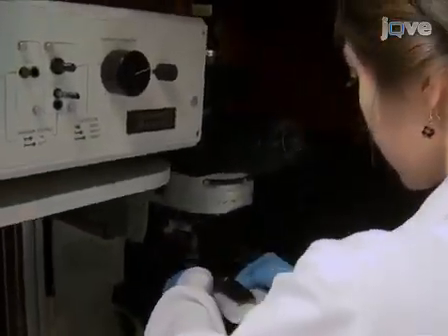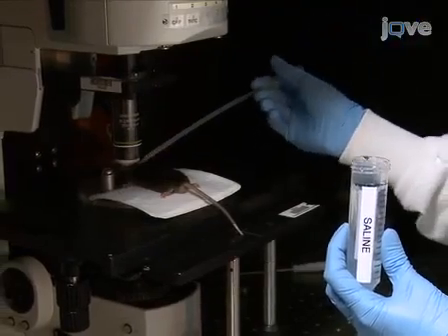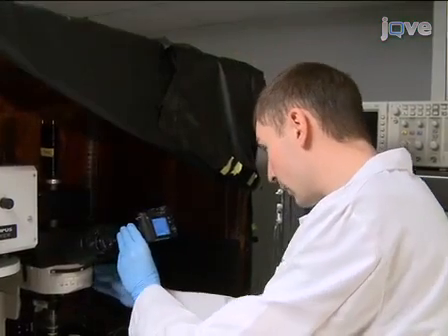In preparation for two-photon imaging, cover the thin skull cortical window with saline and locate the area of interest under epifluorescence. To enable subsequent imaging of the area, take a picture using a photographic camera.